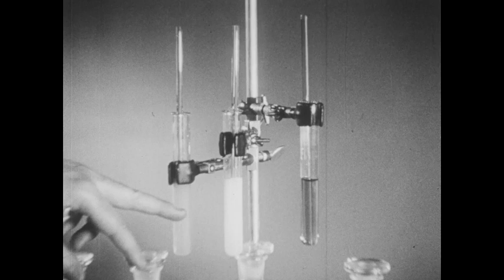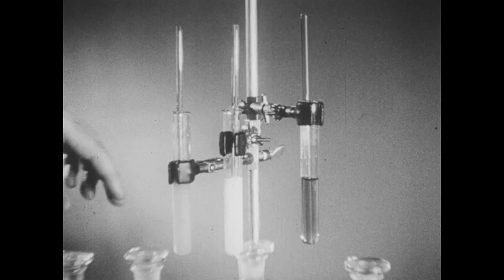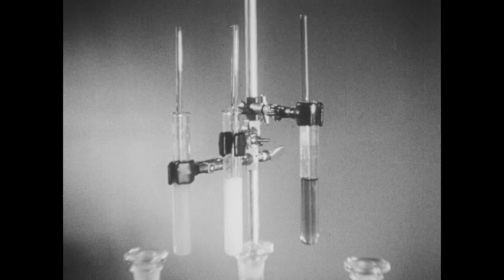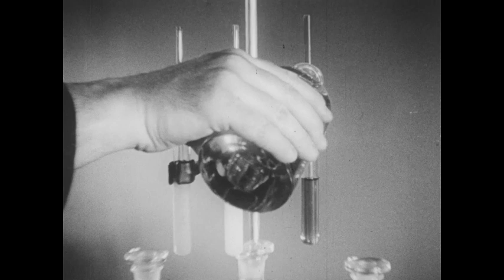This indicates that cadmium sulfide and zinc sulfide are less soluble than nickel sulfide, since enough sulfide ion was present in those two tubes to cause precipitation, but an insufficient quantity was present in the nickel tube. A salt of hydrosulfuric acid should ionize in a normal way and provide a large concentration of sulfide ions. Ammonium sulfide is a soluble sulfide salt, and to the tube containing the nickel sulfate solution, I'll now add a few milliliters of ammonium sulfide.